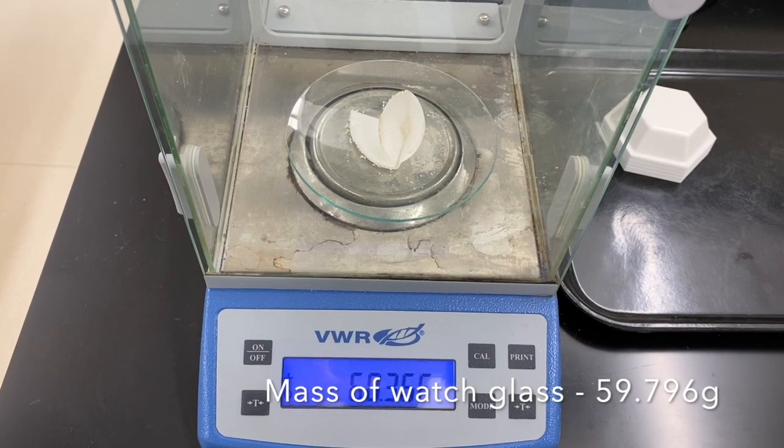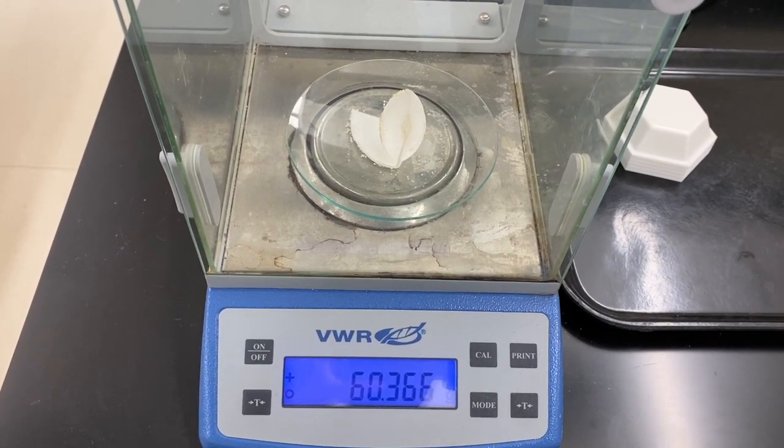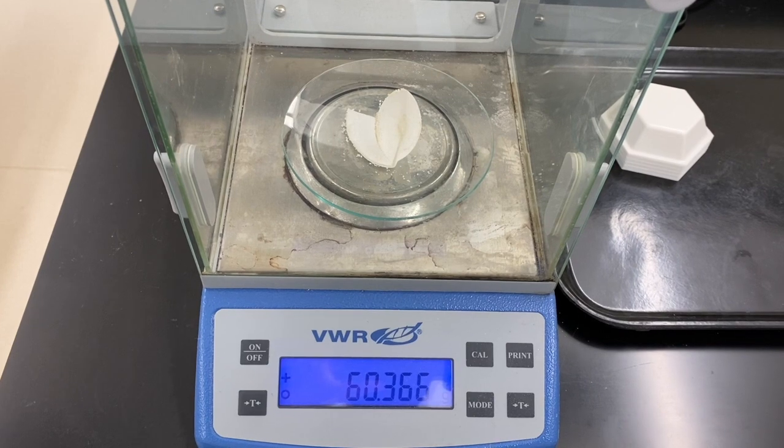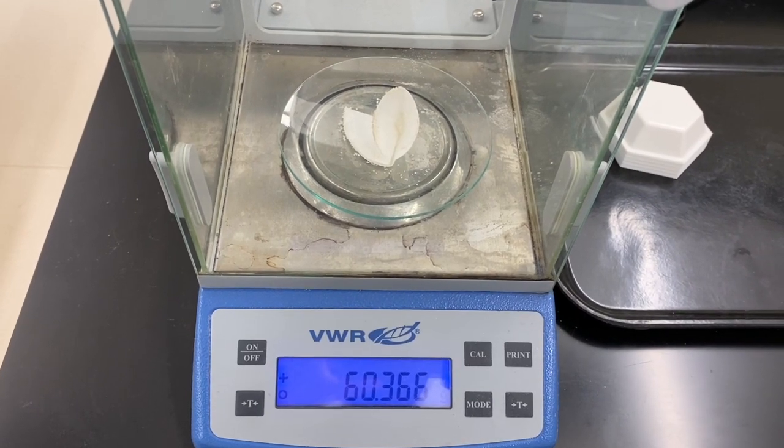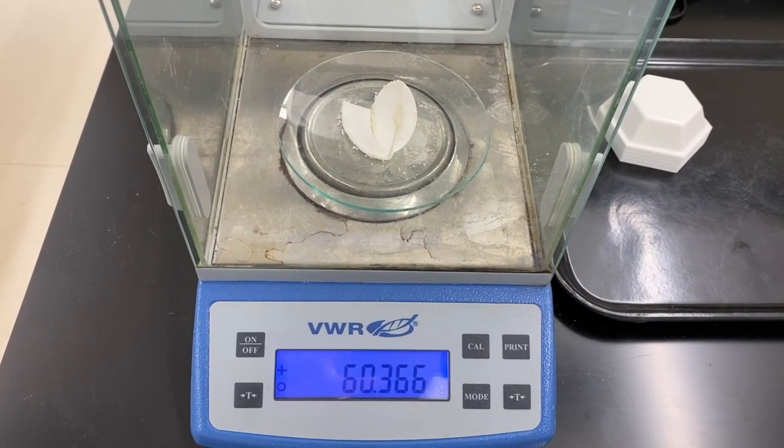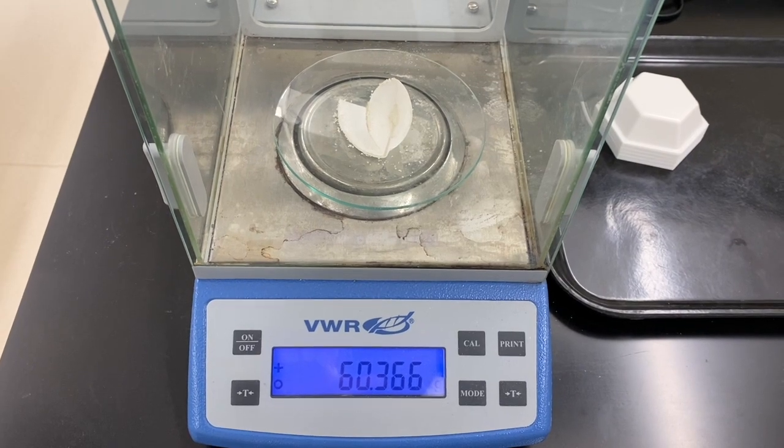This is the mass of the filter paper, the solid, and the watch glass. The masses of the filter paper and the watch glass should either pop up right now or have been reported to you earlier in the video.